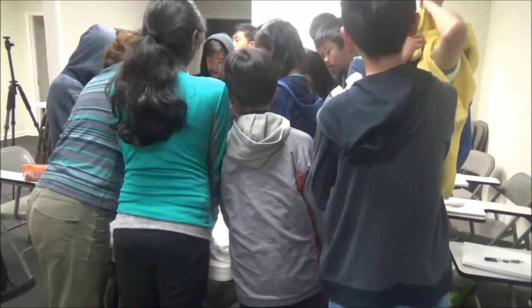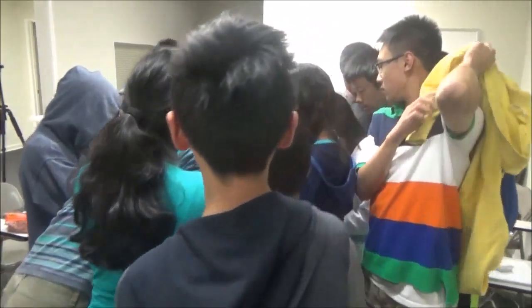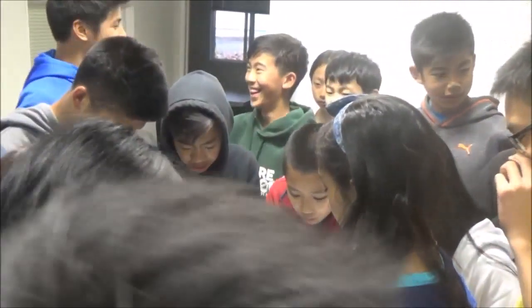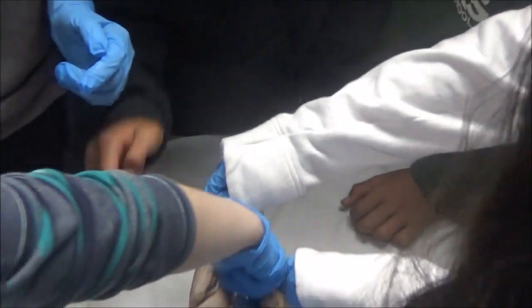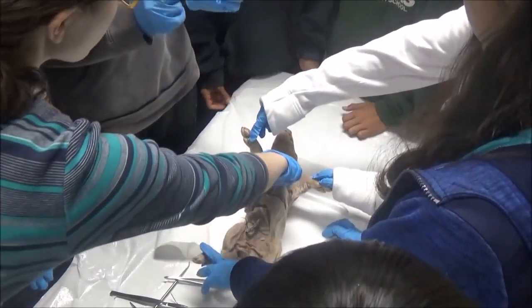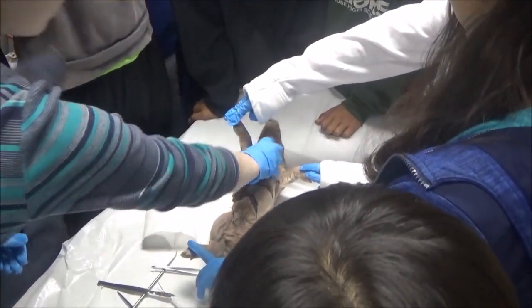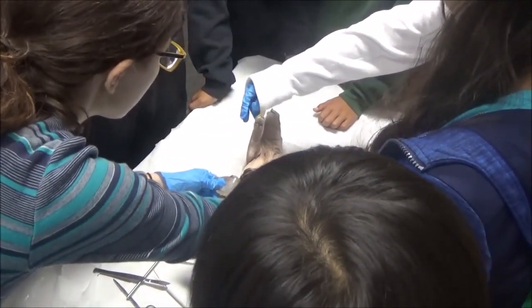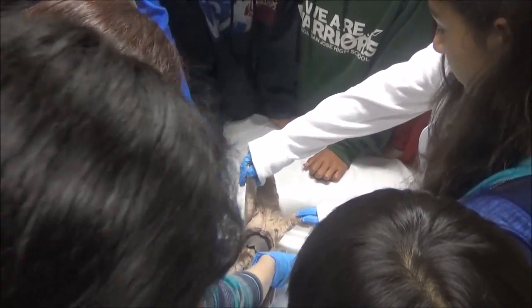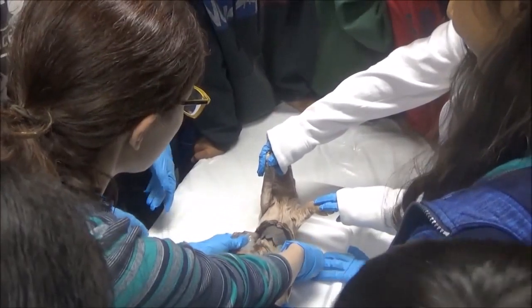I see a little red thing. That's a great question — where's the heart in your body? Thoracic cavity, over here under your ribs. And where are the ribs of this pig? Thoracic. So this is its ribs, and its heart is going to be here in what's called the thoracic cavity.